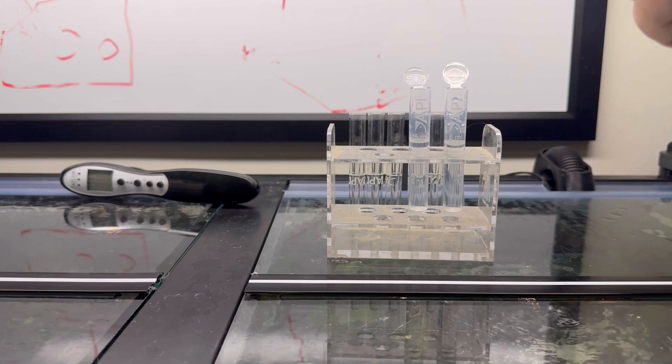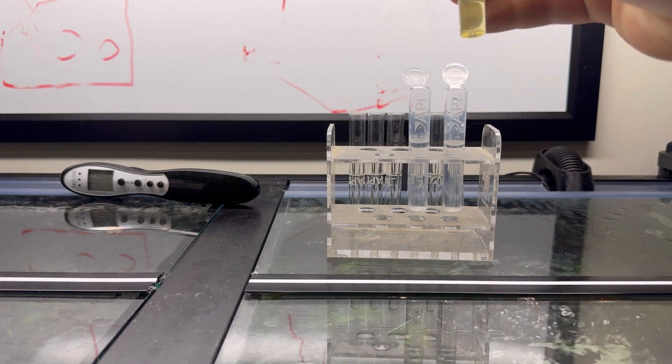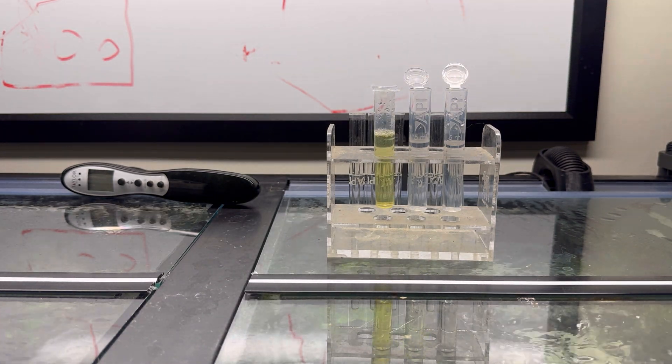Cap it, remove it from your test tube stand. If you don't have one, just make sure you're doing it in a location that if you spill it, it's not going to harm any tanks. Five seconds, that's all I like to do with these. Cap it, set it aside.